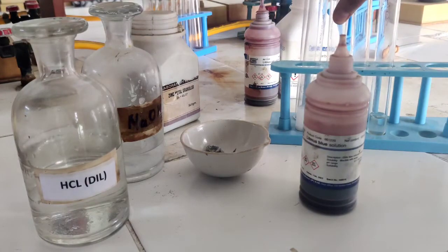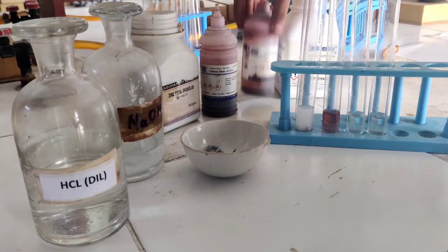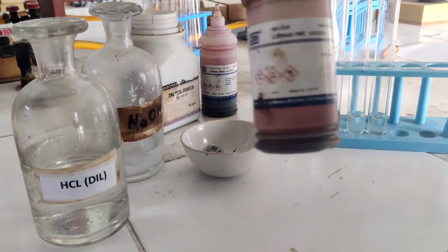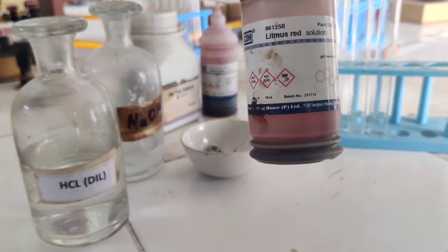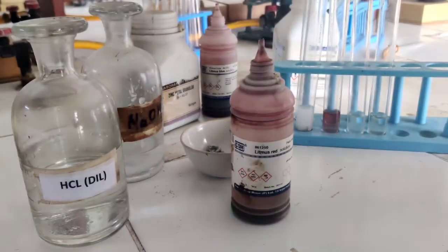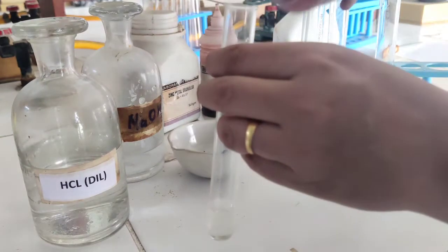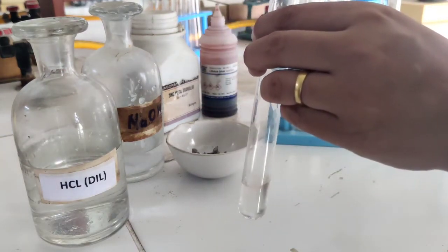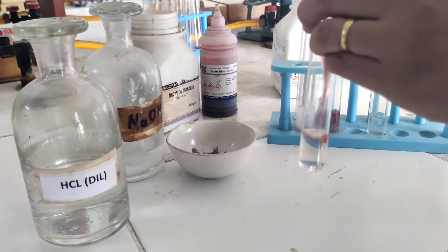The next experiment is to add red litmus to the HCl. As we know, red litmus will remain red in an acidic solution. If we take a base, then it turns blue. But since HCl is an acid, when we add red litmus into the acid, it remains red, which confirms that HCl is acidic in nature.